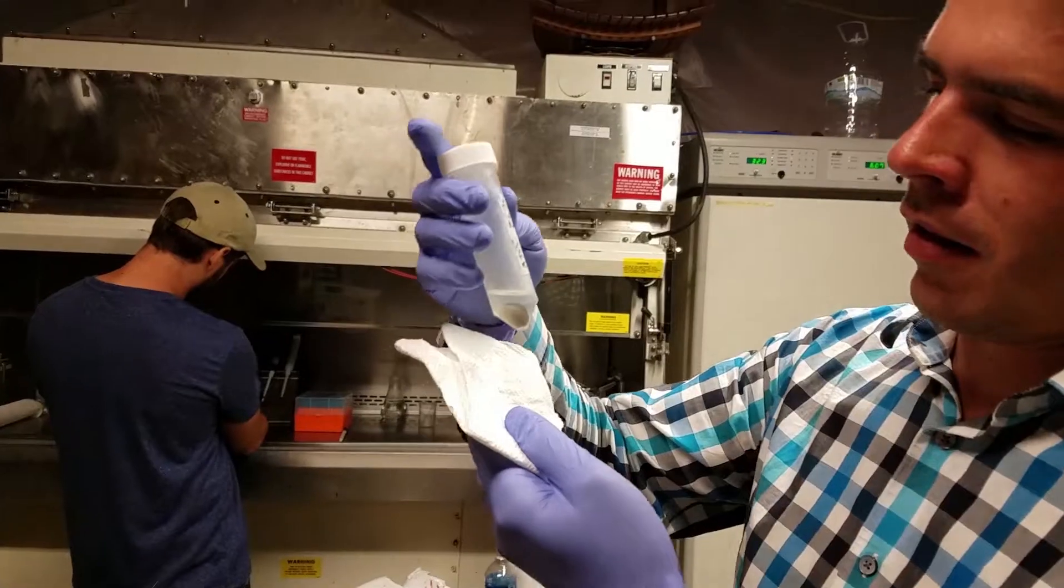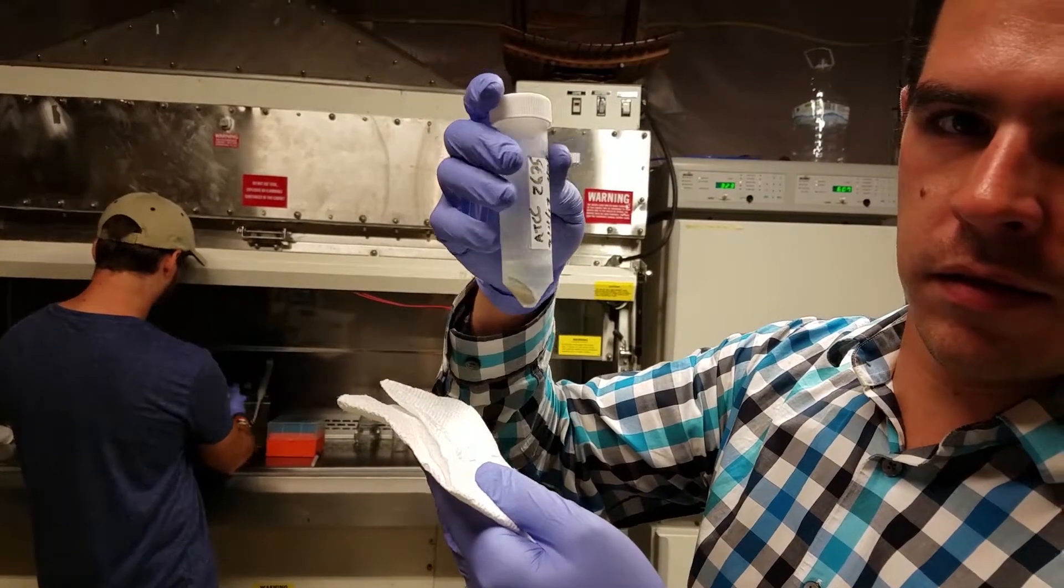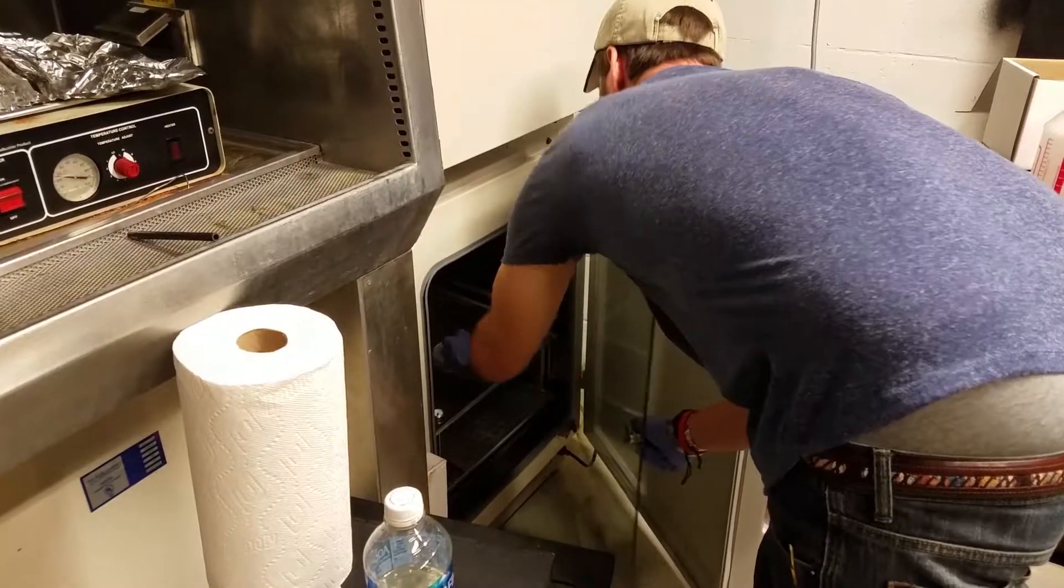Okay, we just ended. We put the spores in the growth medium. We're done with that part.